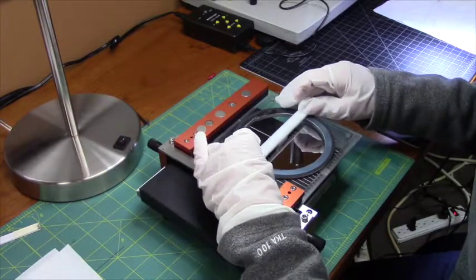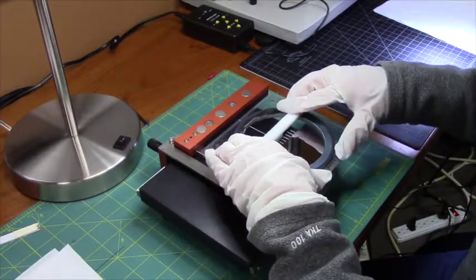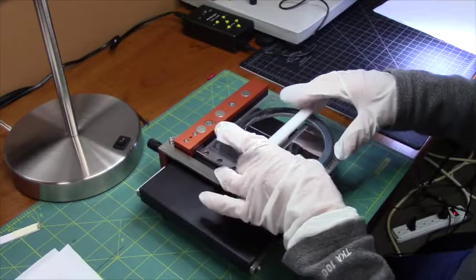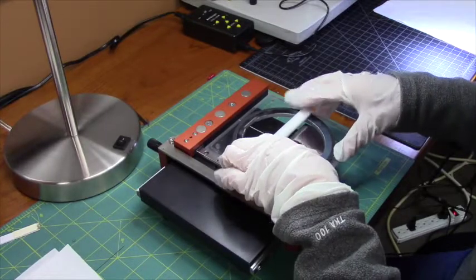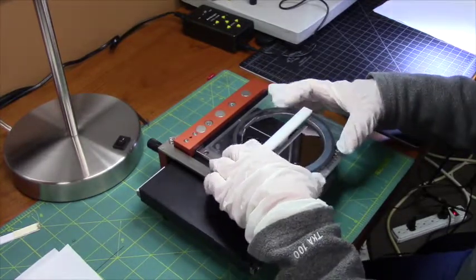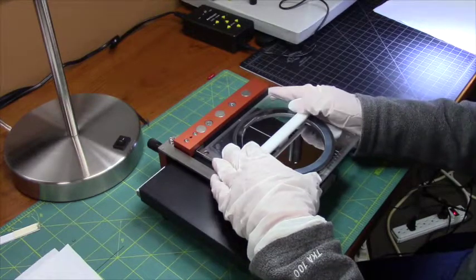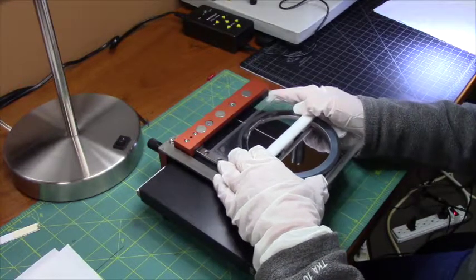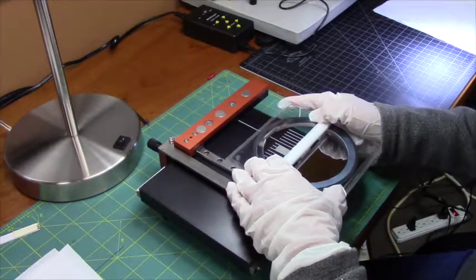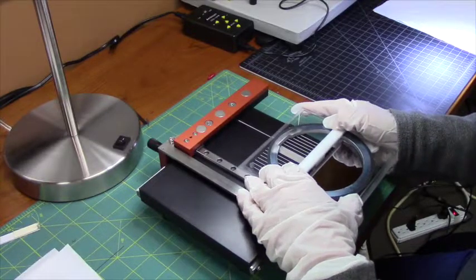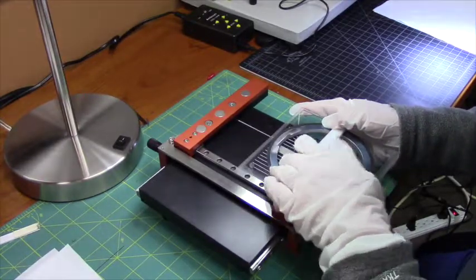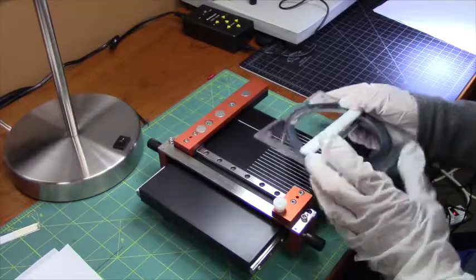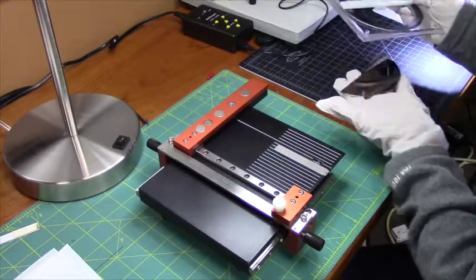I am just going to check for the positioning. Now I am going to slide the whole holder against the scribe. And we can look at the scribe line.